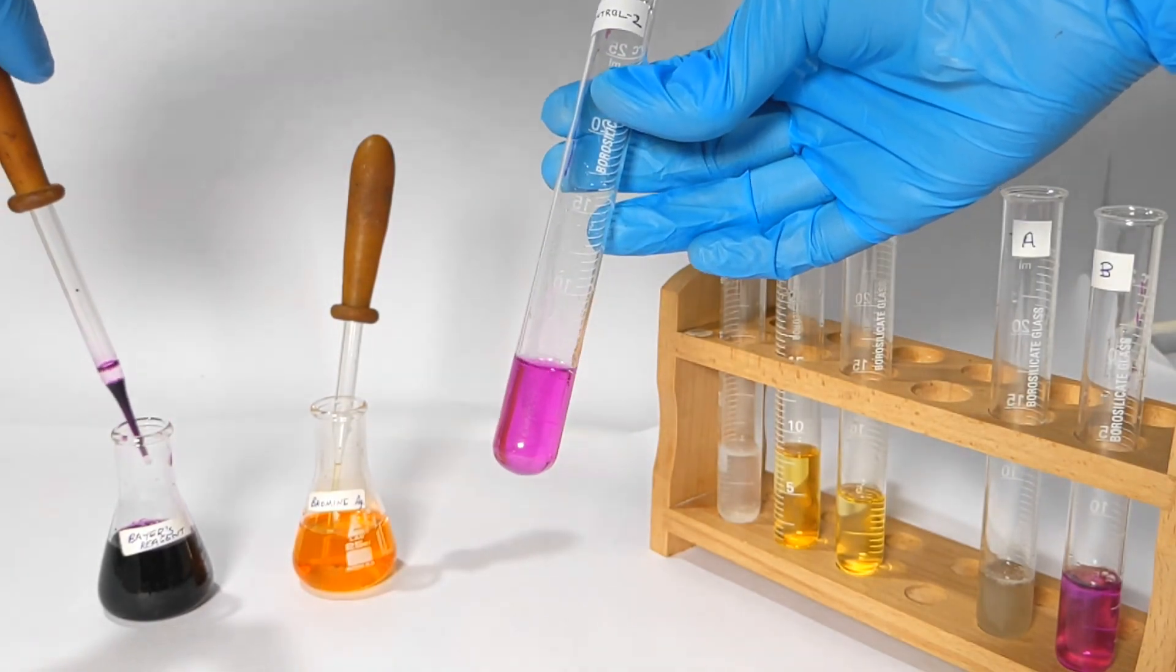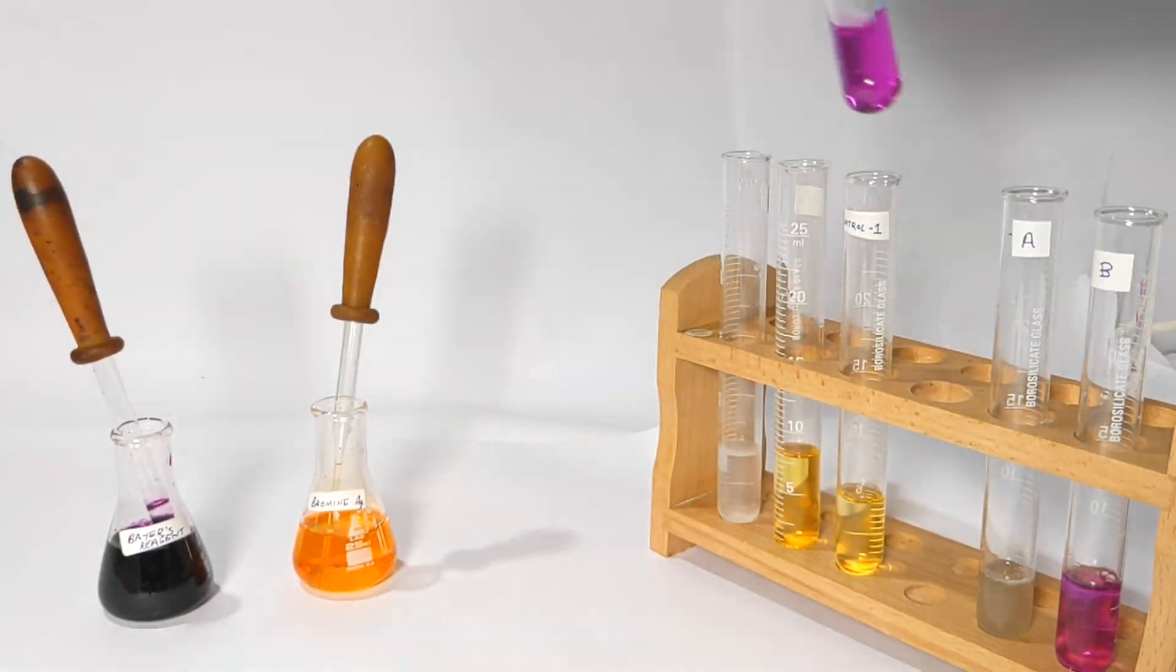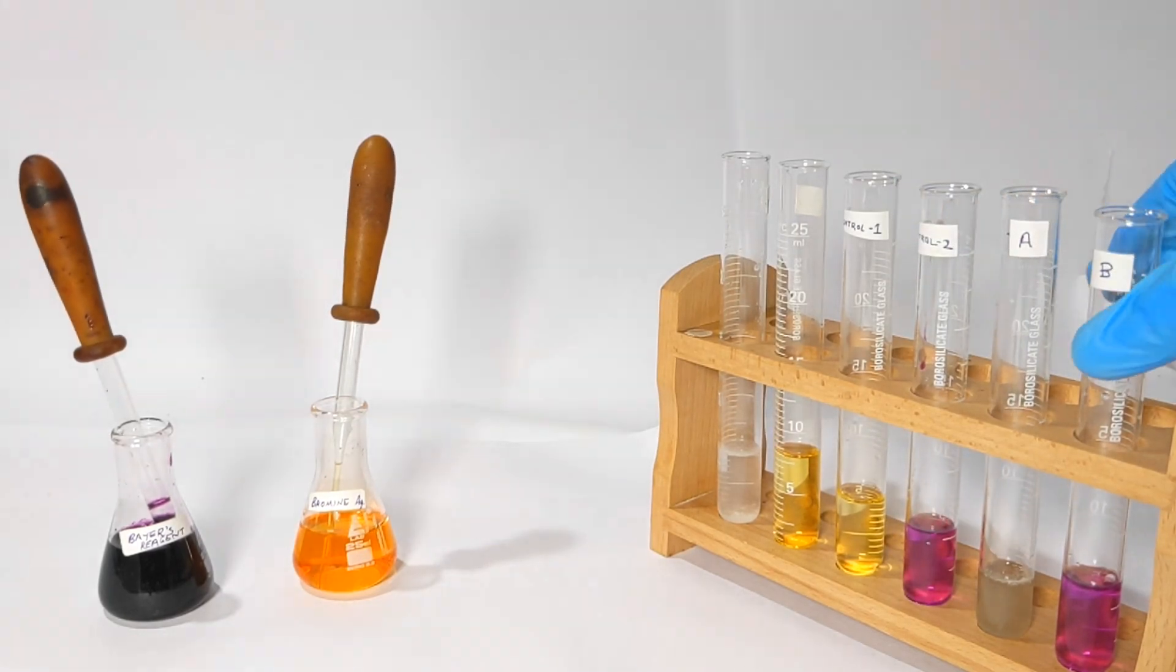Therefore, the compound in test tube A is unsaturated and in test tube B you have saturated organic compound.